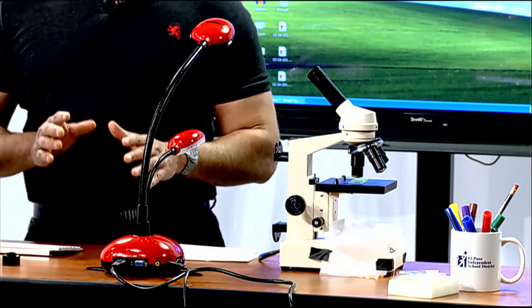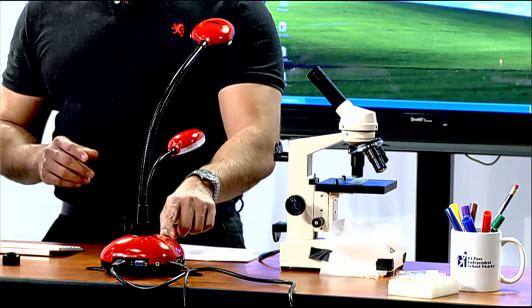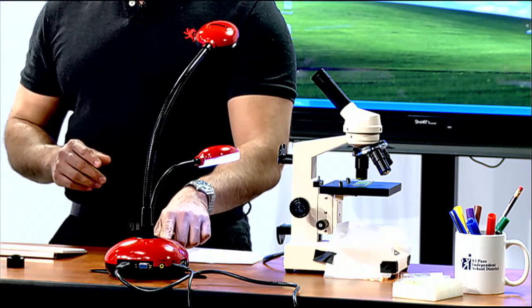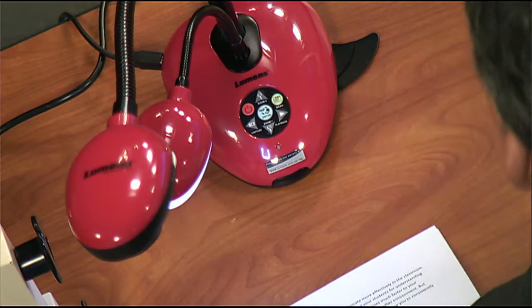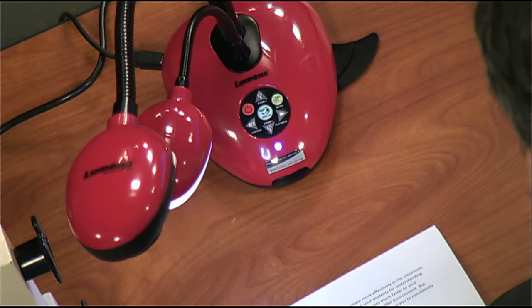So now, guys, let's go ahead and try to use our Ladibug camera with our microscope. If you remember back from our very first video series, I need to turn on the camera itself. I can turn it on by hitting the red button here, which I'm going to go ahead and do, and it's going to turn to a blue light, and when it's a steady blue light, that lets me know that it's working properly. It's warming up. There we go. And now just steady blue, my camera's ready to work with my computer.